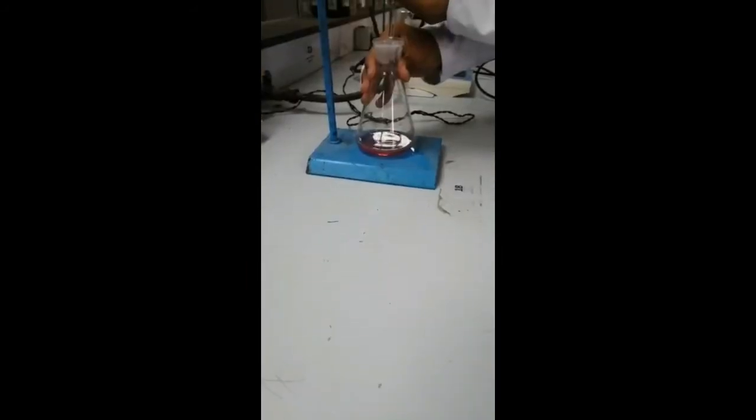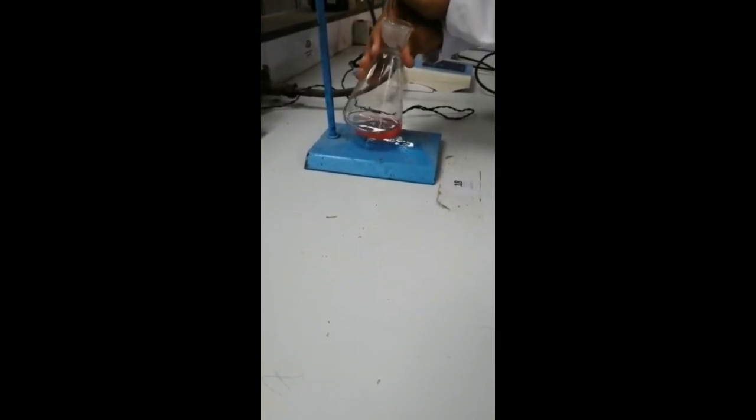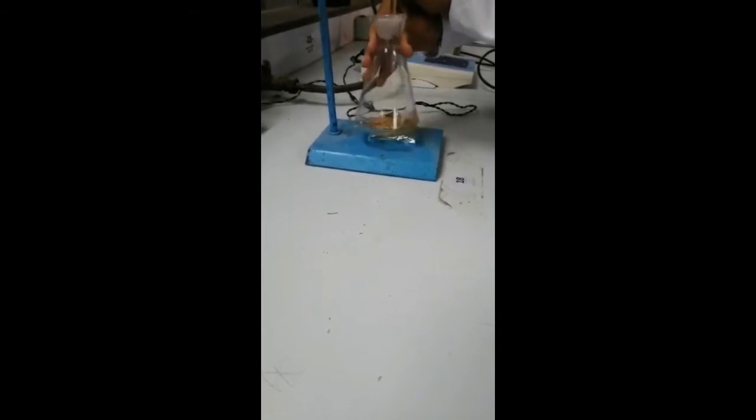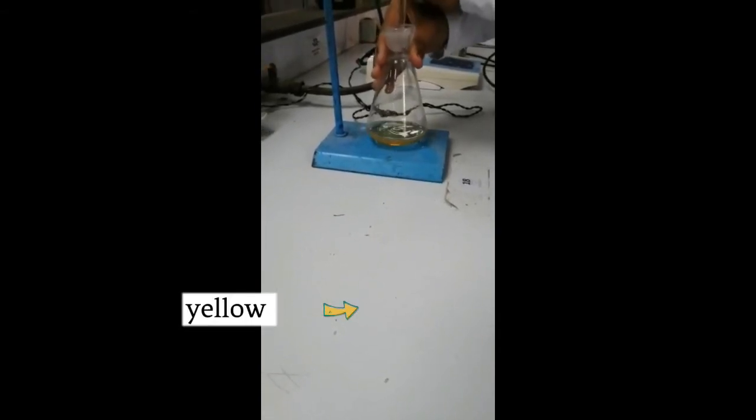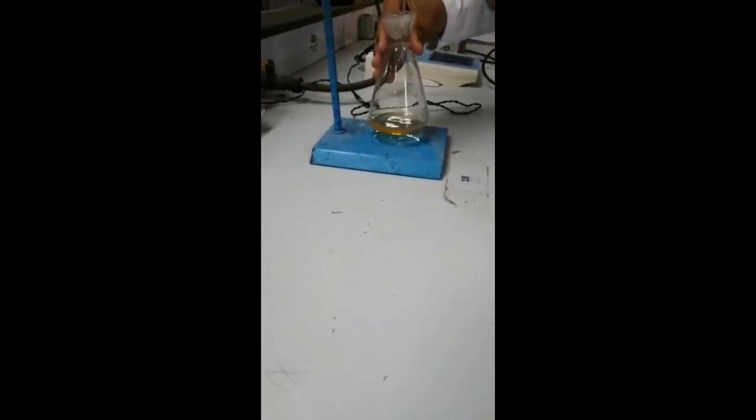As for the procedure, on the same conical flask, we add neutral glycerol, we add double the volume of 0.1 N HCl used, we add 10 drops of phenolphthalein, and we titrate with 0.1 N sodium hydroxide till the endpoint.